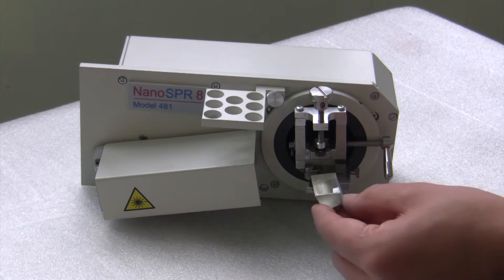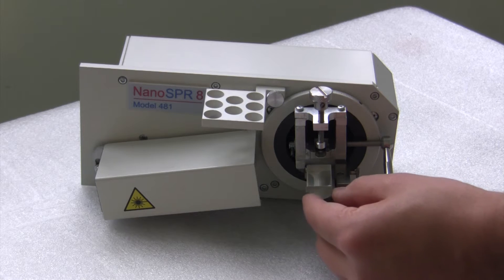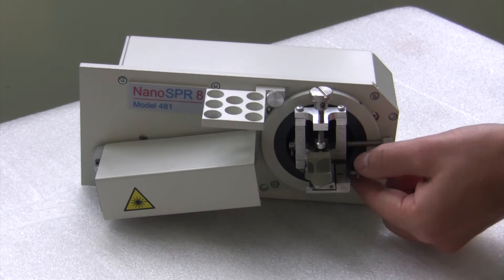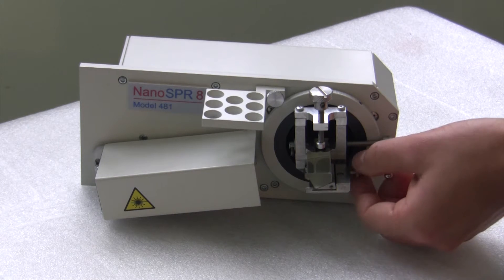Setting up an experiment is quite simple. First you need to install the prism by sliding the prism holder into grooves and tightening the screw.